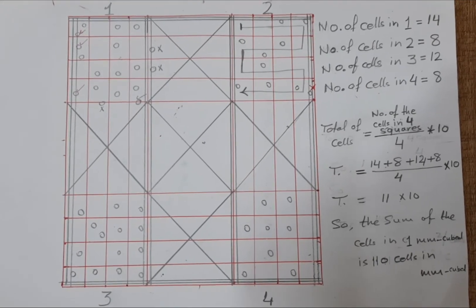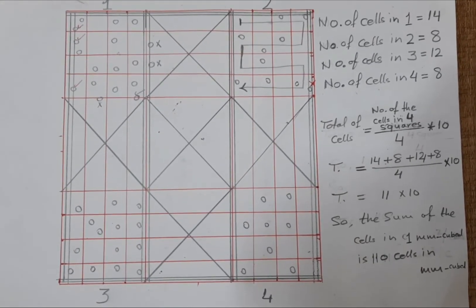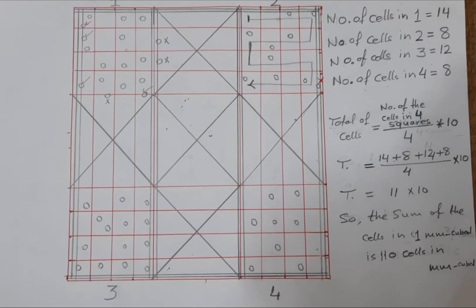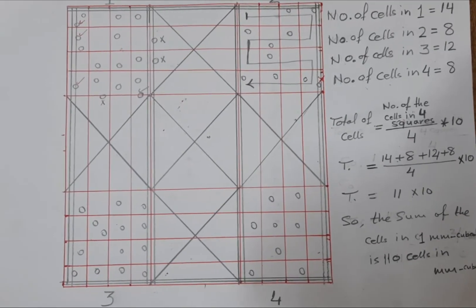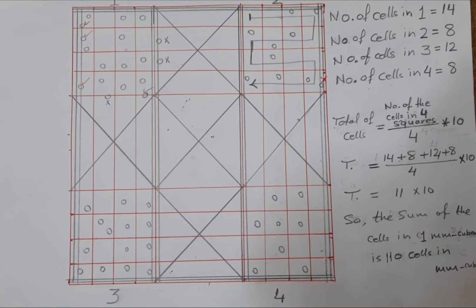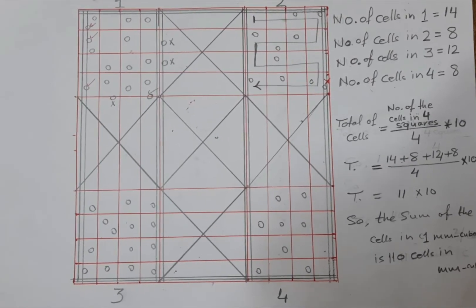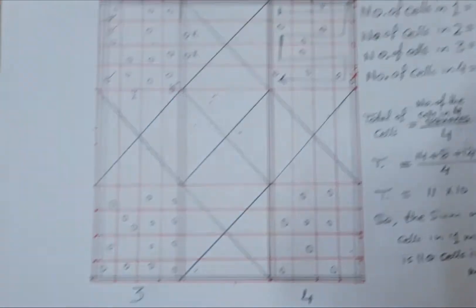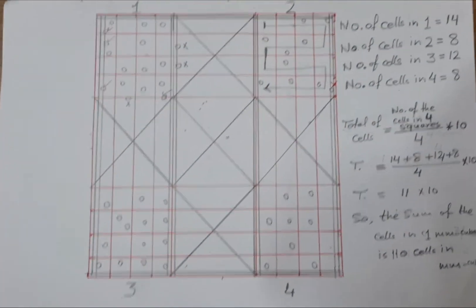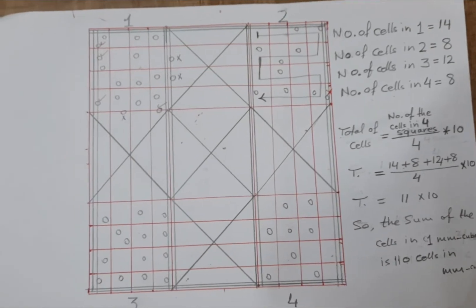The average multiplied by 10 gives the number of cells in 1 mm cubed. In the hemocytometer operation, we count specific squares to determine cell density.